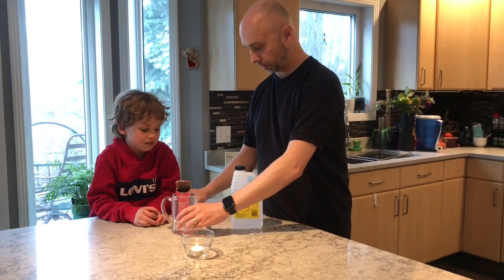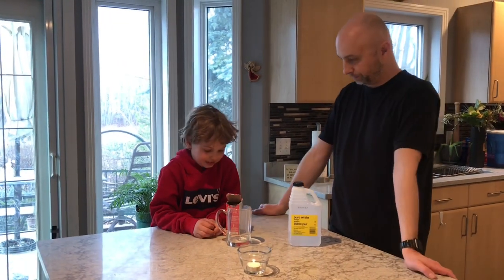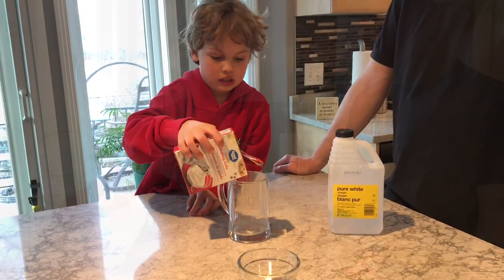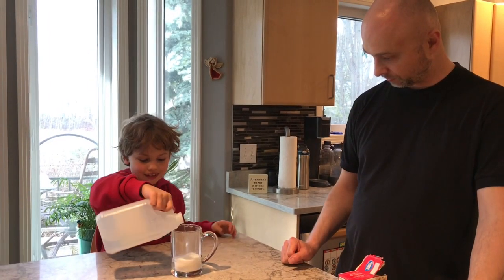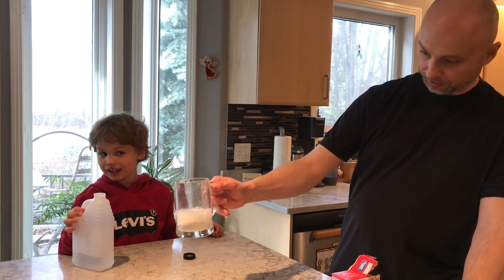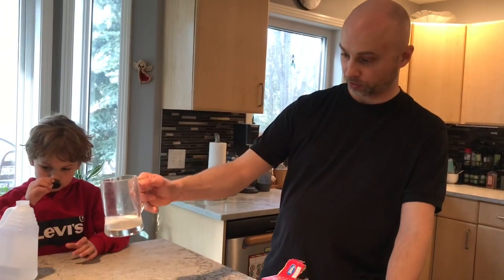So, Professor Marcus, can you dump a little bit of the baking soda into the cup? How much? No, just a little bit. Go ahead. Okay, that's good. You can see how it's all bubbling. Gas was obviously formed. That's what created the bubbles.